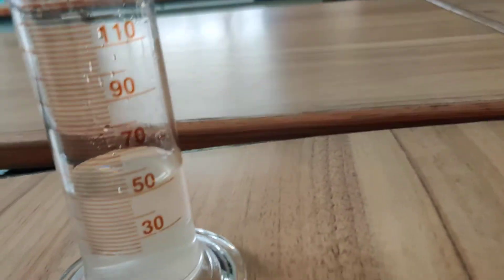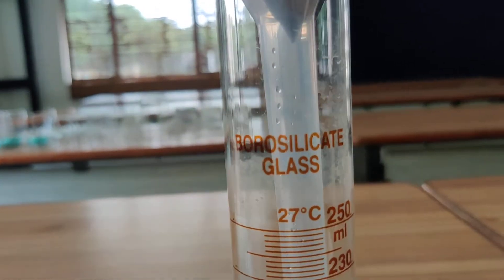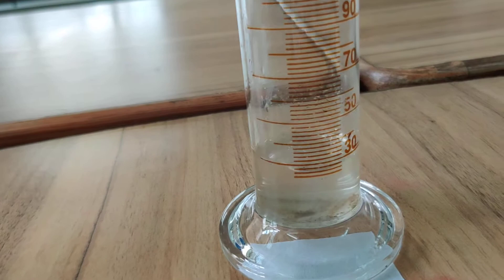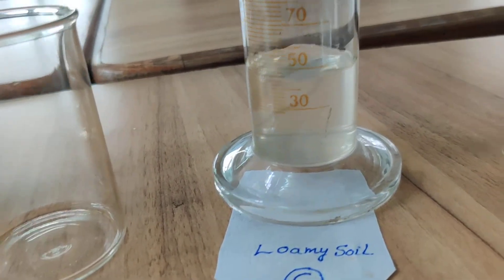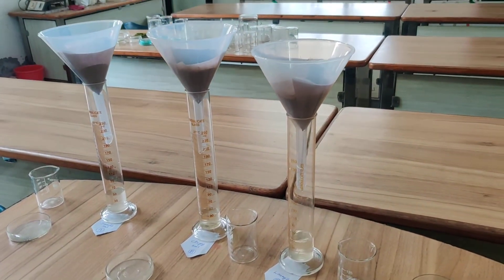The final reading collected will be the rate of percolation. This is the apparatus for sandy soil, this is for clay soil, and this is for loamy soil. We take readings after three minutes from the start of the experiment, then again after three minutes, repeating up to twenty minutes. Note down all the readings. Thank you.